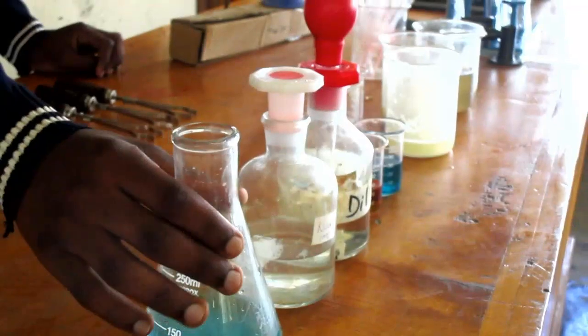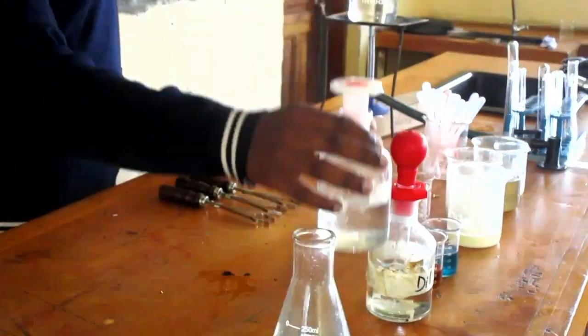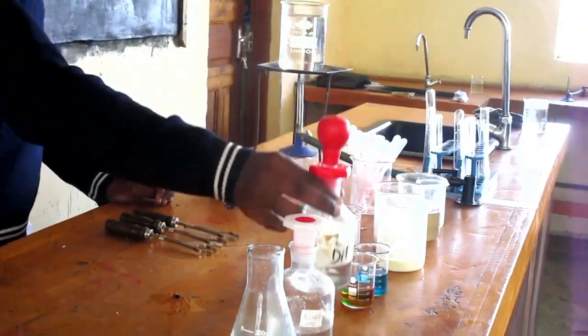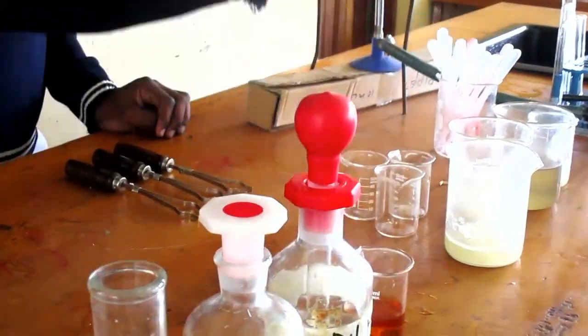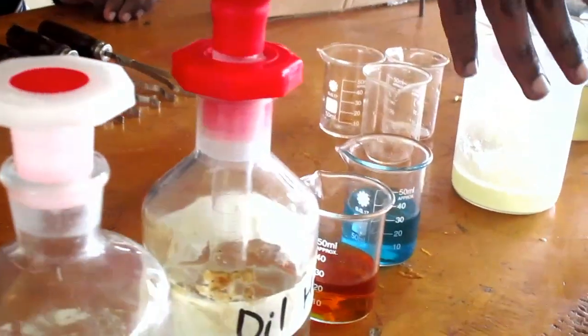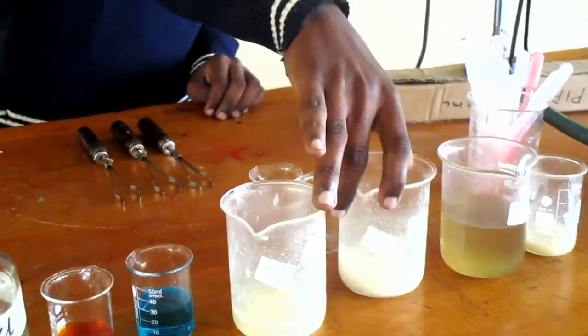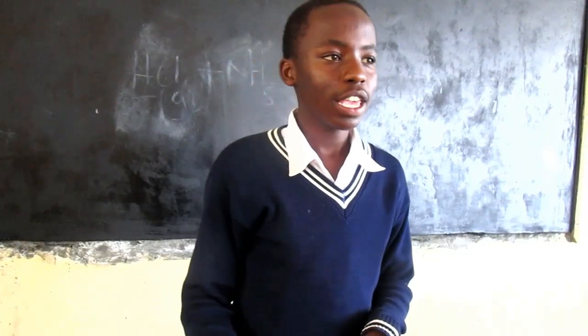In front of us, we have got chemicals and reagents which are going to be used for the experiment. Here I've got copper sulfate, sodium hydroxide, dilute hydrochloric acid, iodine solution, and Benedict's solution. We also have sample A, sample B, sample C, and sample D.